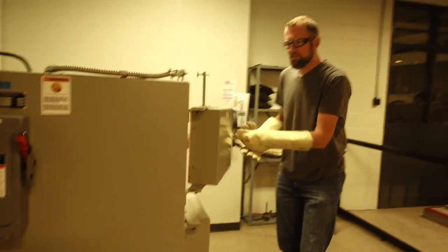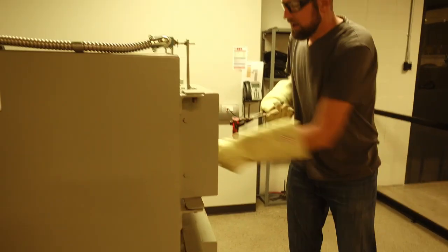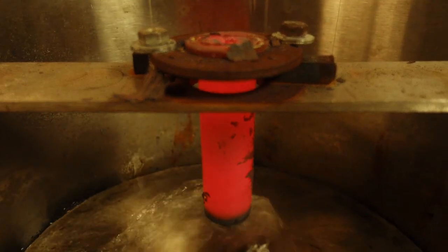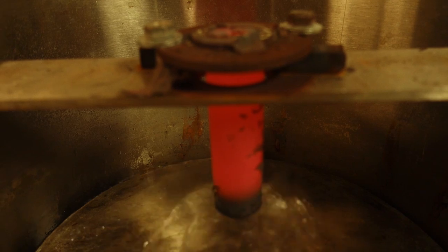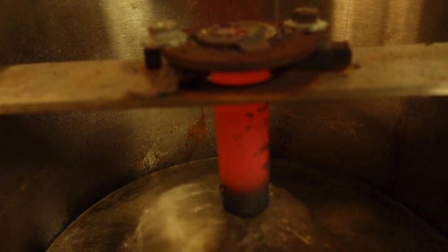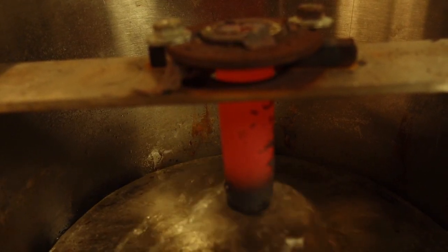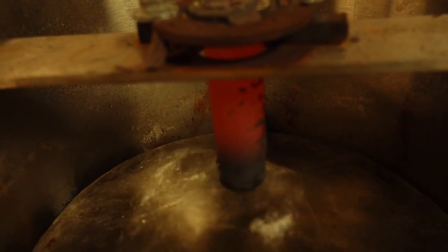The sample has been sitting in the furnace for half an hour now. It's nice and hot. And we're just going to quickly take it over here and drop it in place. You can see the whole disc sort of slowly moving up as the red hotness is releasing. The bottom has quenched very quickly. The top is still very hot, essentially being air-cooled.